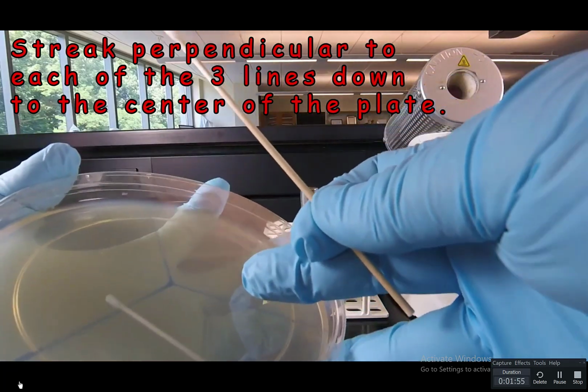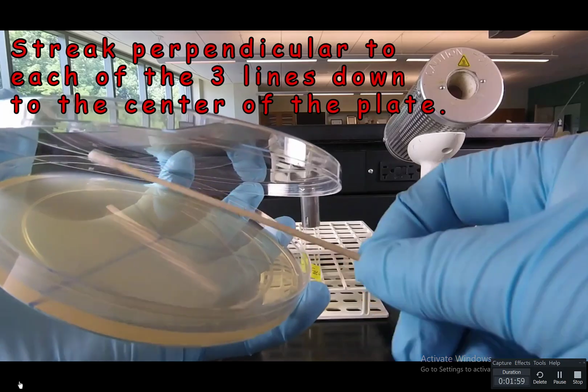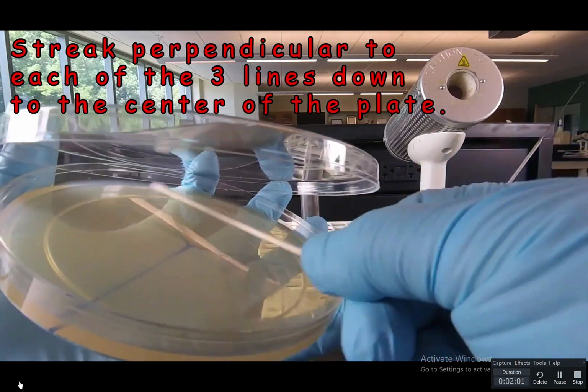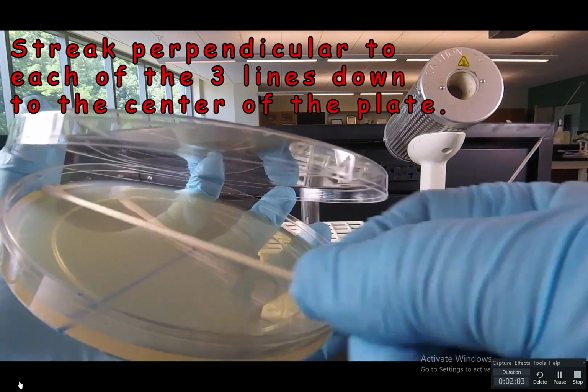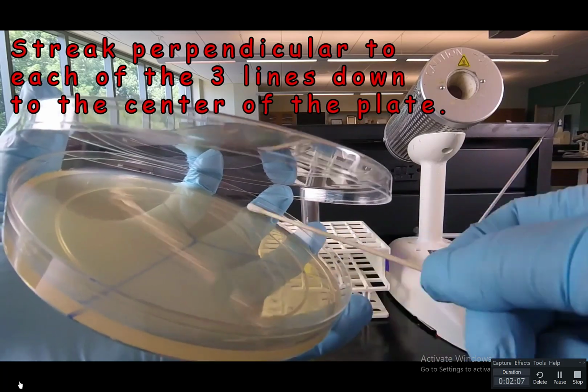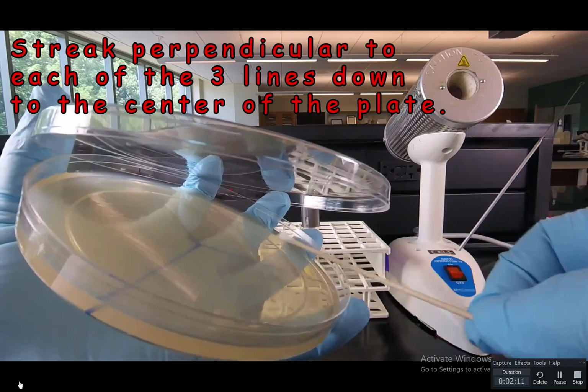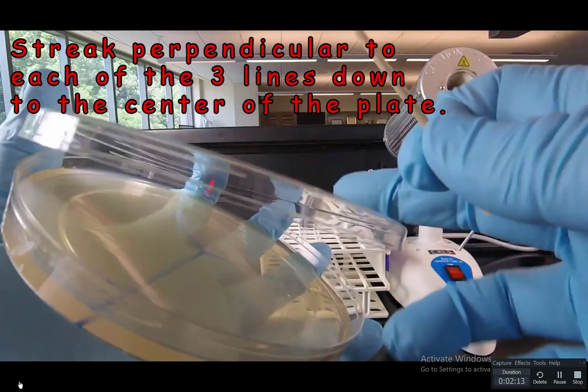Again, all the way to the edge and all the way to the center. Use the same swab. You don't have to dip it in again. So again, all the way to the edge, overlapping the lines, till we hit the center.